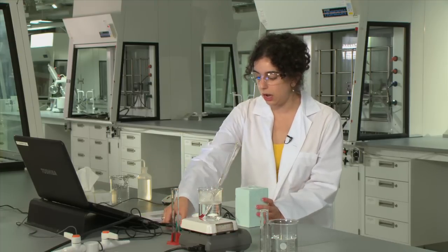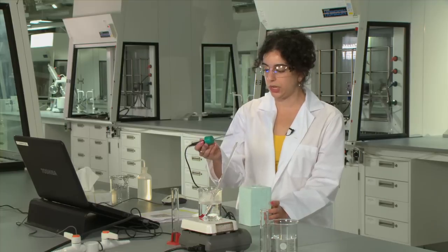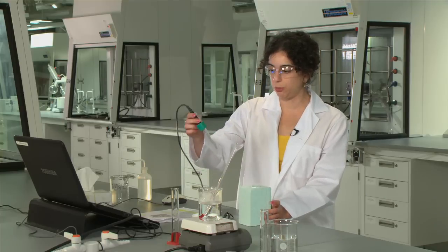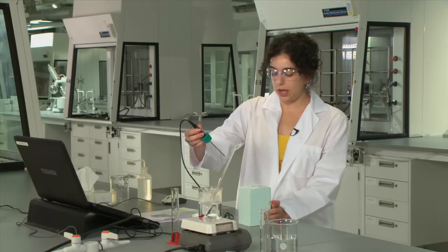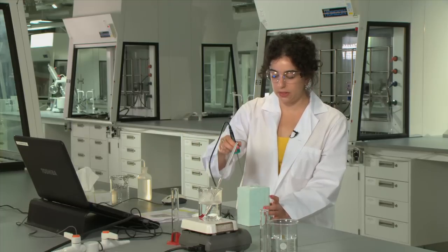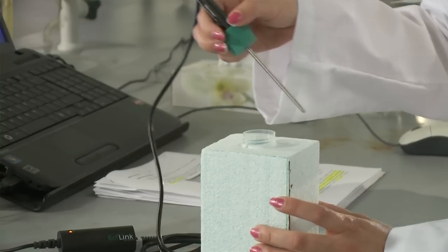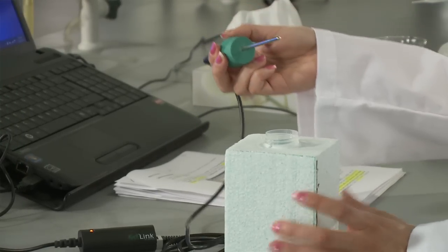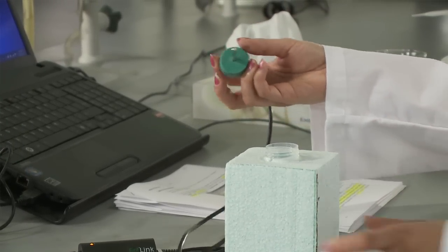We're also going to be monitoring its temperature using a Vernier temperature probe and this is basically going to sit in the calorimeter and allow us to take measurements using the Logger Pro software on the laptop computer.